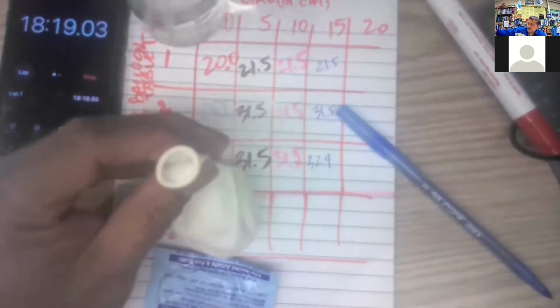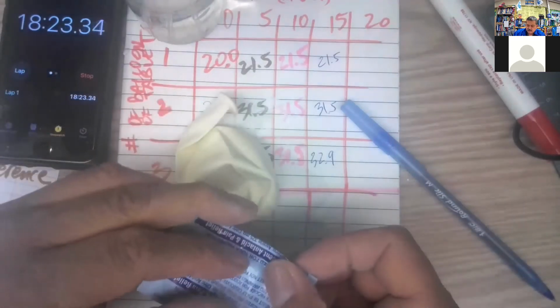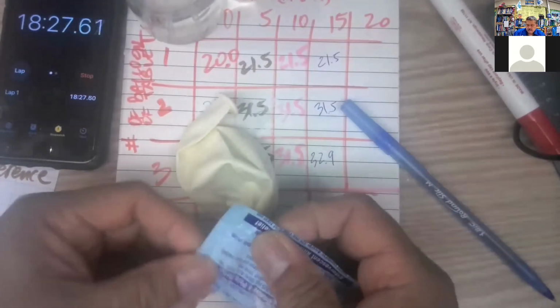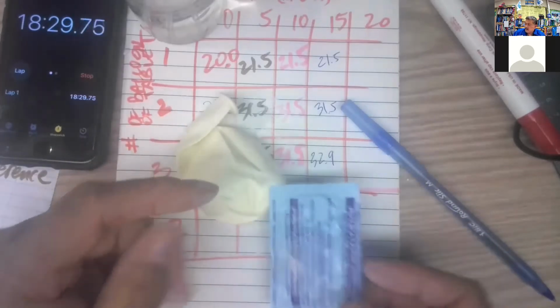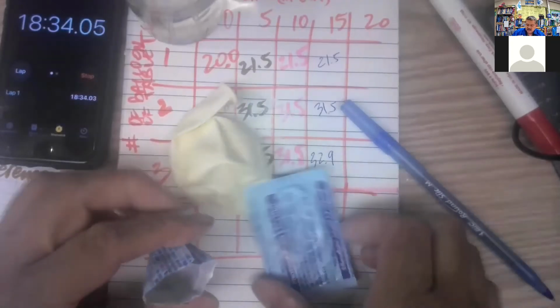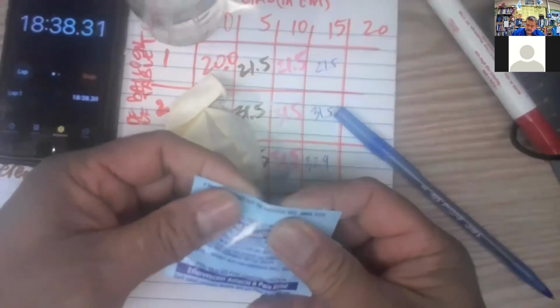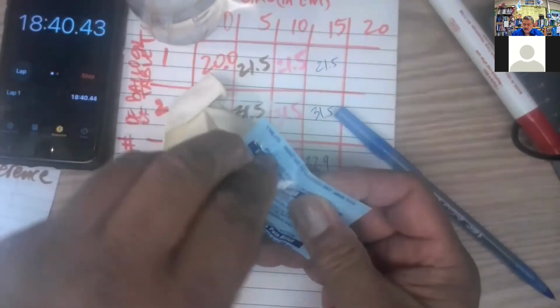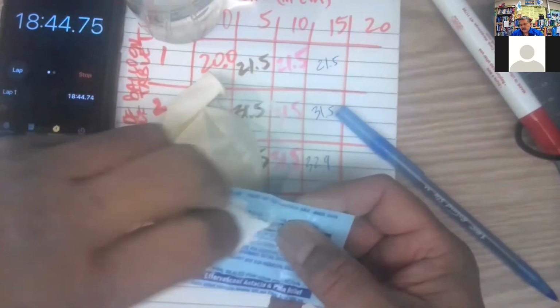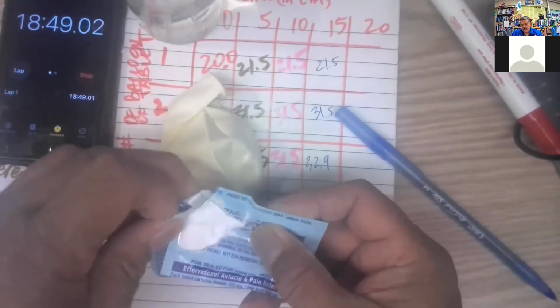All right, so there's tablet number 1 away. Open this up. Oh, I cracked the envelope, so I'm gonna use this other envelope, I think. Or I can put it on a paper. Let's see. Here's what you have available.